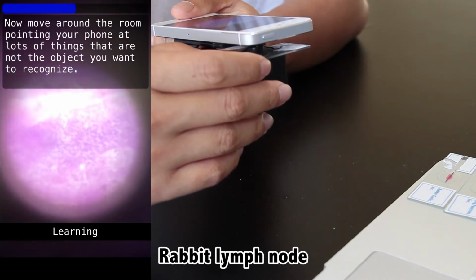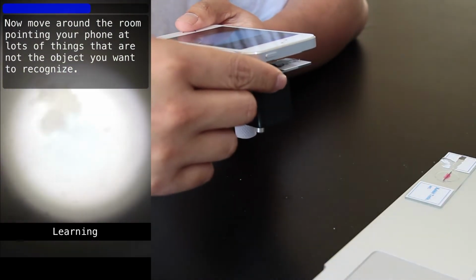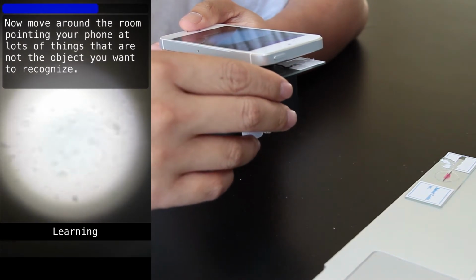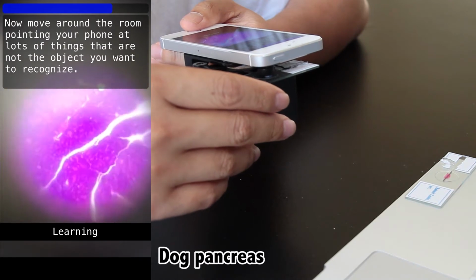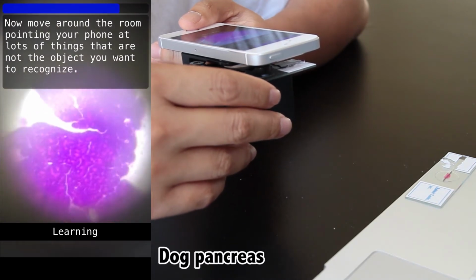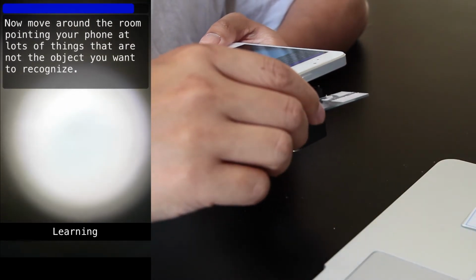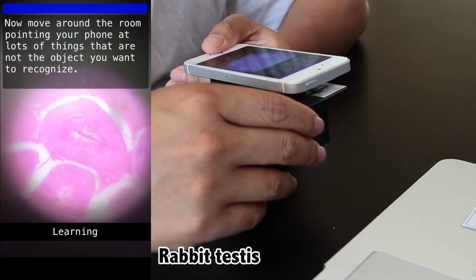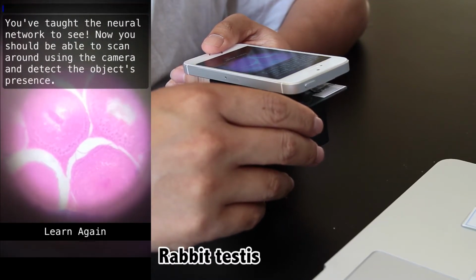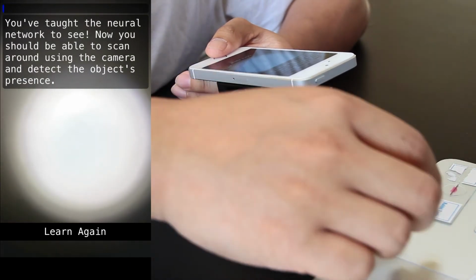But this algorithm also has certain limitations that you can see in this app, mainly that it's generally computationally expensive. It takes a lot of calculations for it to learn something, because it doesn't scale well the more stuff you show it. For instance, if the training set was 10 times bigger, the number of calculations wouldn't just be 10 times more, it would be more like 30 or 50 times more. Basically, it's not a linear relationship, it's more exponential, which is why this app automatically drops the camera resolution substantially, and also limits the amount of time you can spend showing it what you want to learn and the counterexamples.